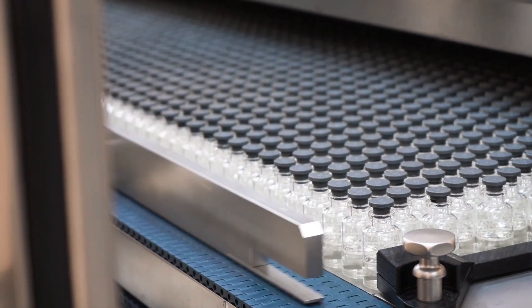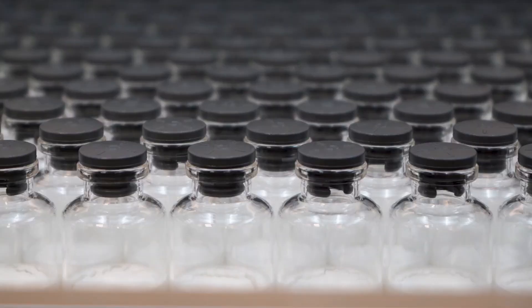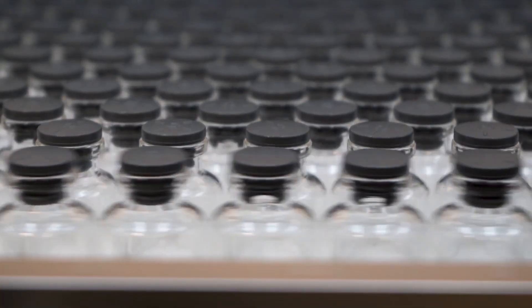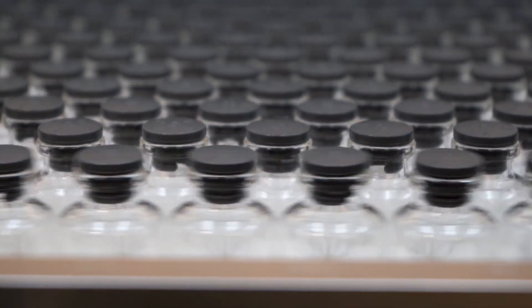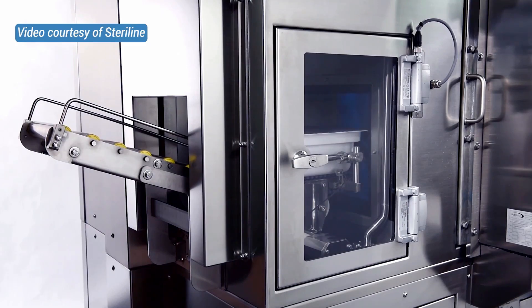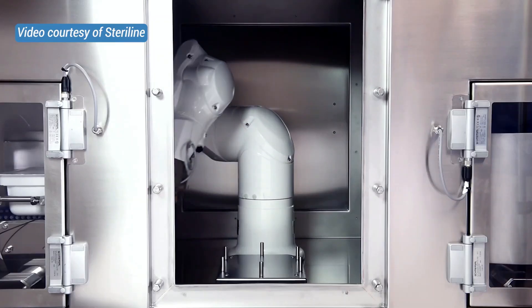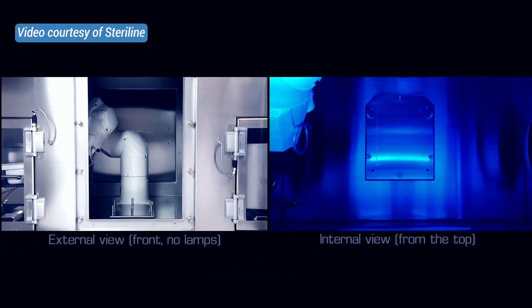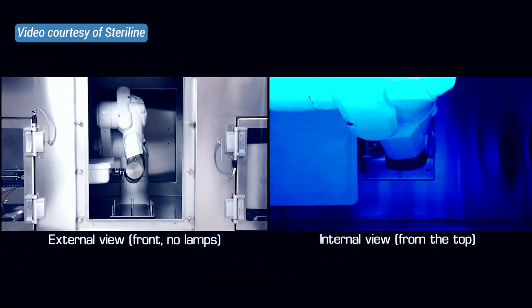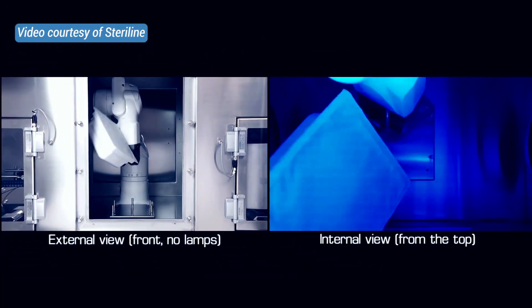Robotic and automated systems: automation is used to reduce human intervention, which minimizes contamination risk. Robots fill and seal vials, syringes, or cartridges under sterile conditions.